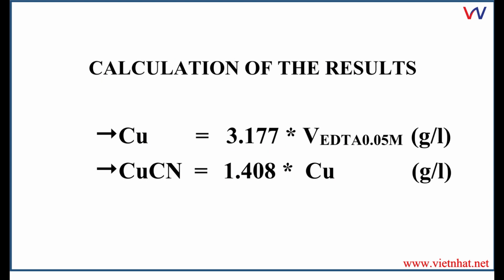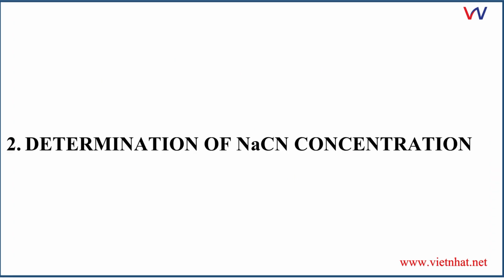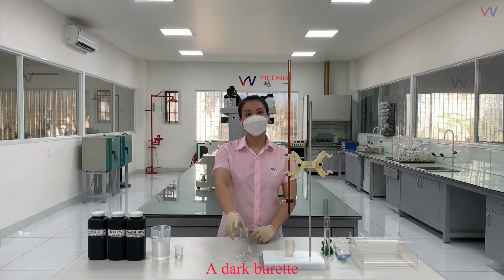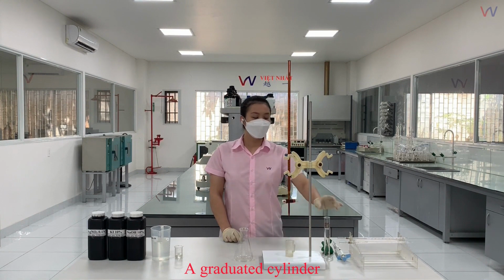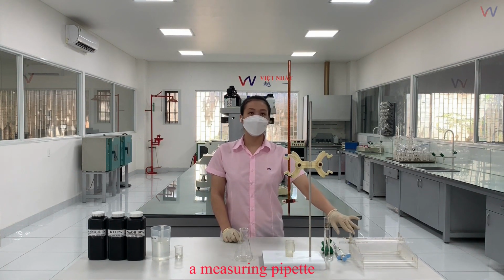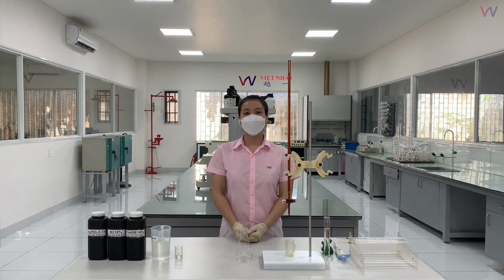Following is the second criterion, the determination of sodium cyanide concentration. The necessary equipment for this criterion includes an Erlenmeyer flask, a dark burette, a graduated cylinder, a micropipette, and a measuring pipette. Similar to before, each pipette should be used separately for different chemicals.